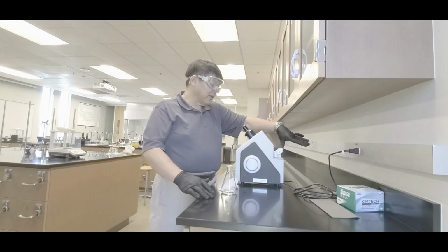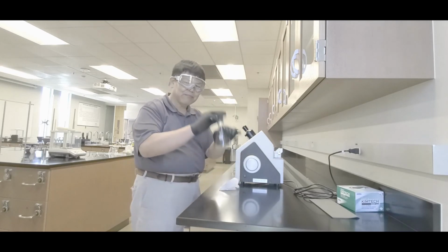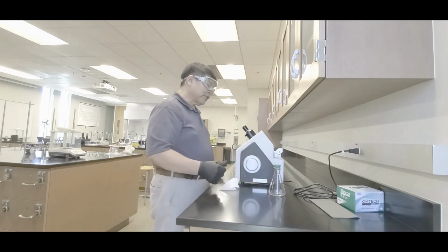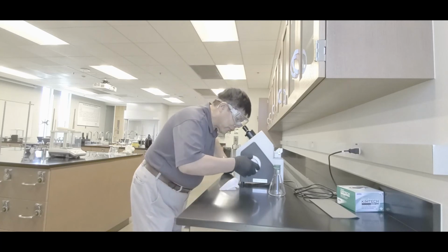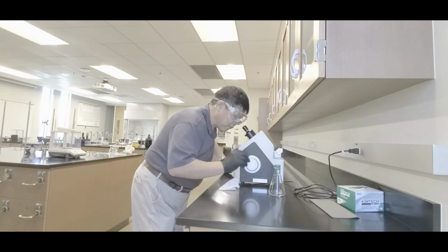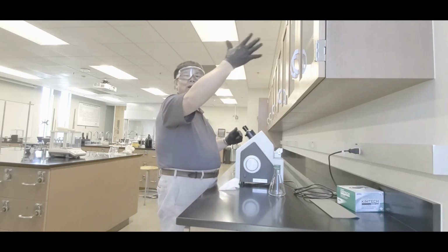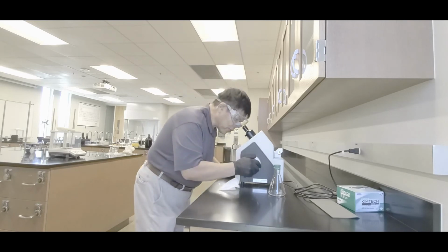Okay, you'll see it. And once that's done, hey guys, make sure you park your eyes back in. And then look down. What you want to do is turn this knob until that X turns to a V with the black on the bottom and white on top. Okay? So you do it like that. All right, there we go.